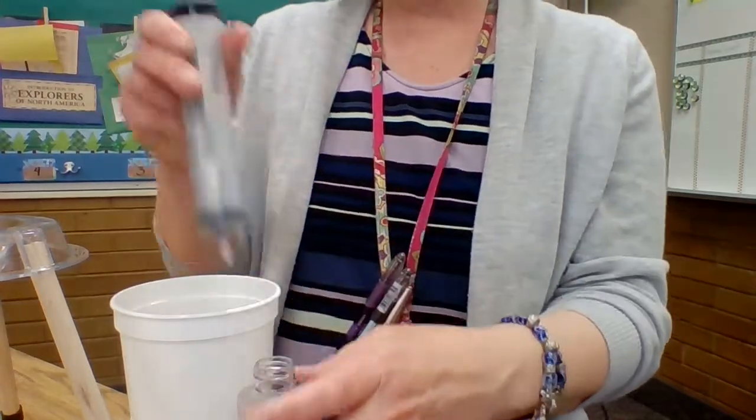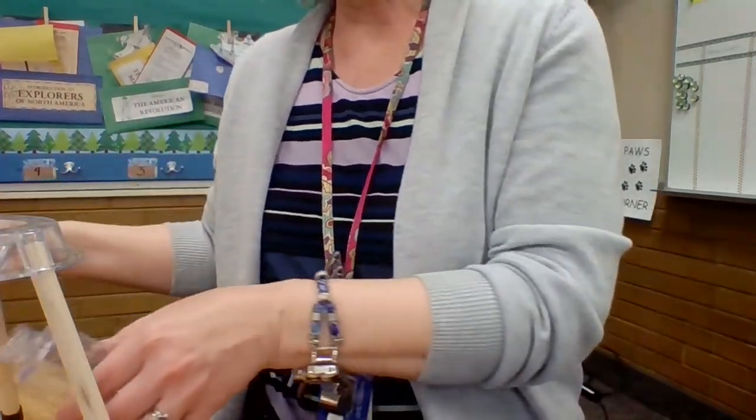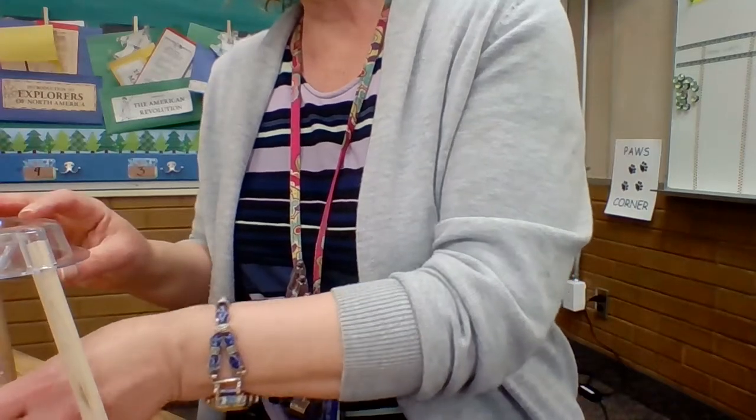Now, I'm going to use a bigger scoop this time. And it doesn't really matter. We don't need to keep track too much of how many scoops we use, because we're going to be weighing it at the end. So at the end, we're going to find out how much dissolved based on weight, not necessarily based on scoops. But just for reference, this is a tablespoon, so it is about 3 times the size of those little scoops that we have been using. So this is about 15 milliliters. Those little scoops are about 5 milliliters.